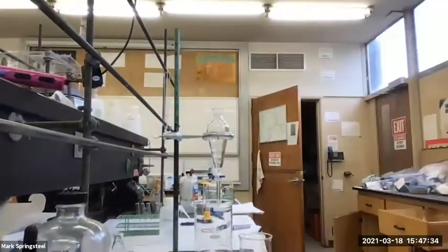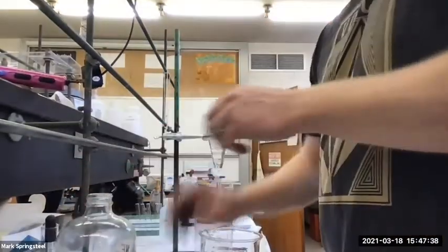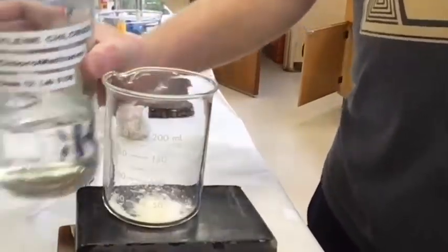Whenever I do these experiments, usually I'll demonstrate some things in a normal setting, not the full experiment, but part of an experiment. I feel like I'm doing a cooking show. I'm Rachael Ray or something. So first we add a little EVOO. Okay, so now we've got the methylene chloride. Let's see if it works better.